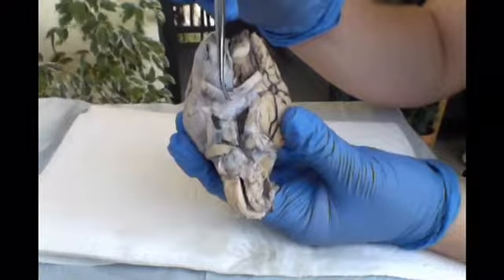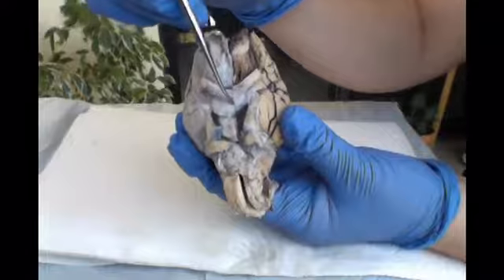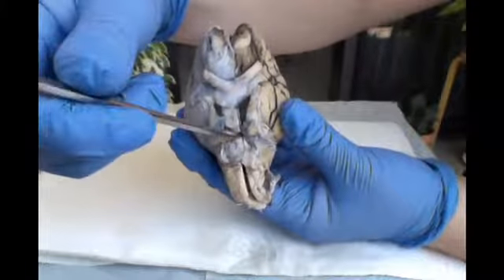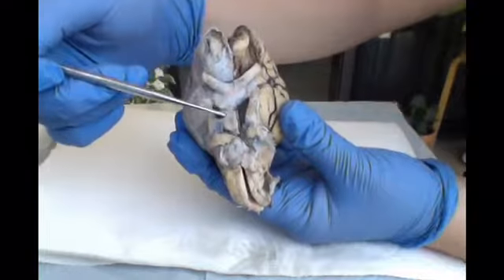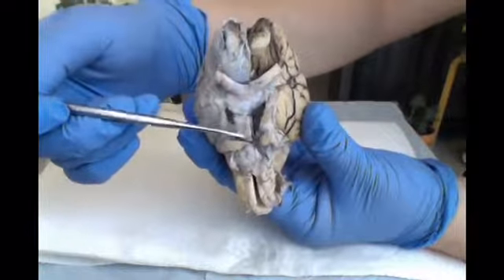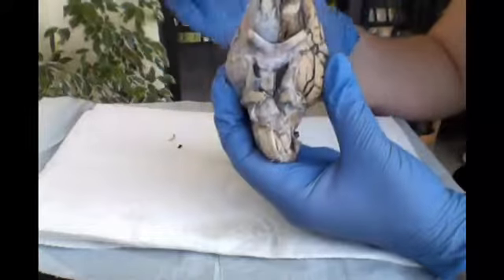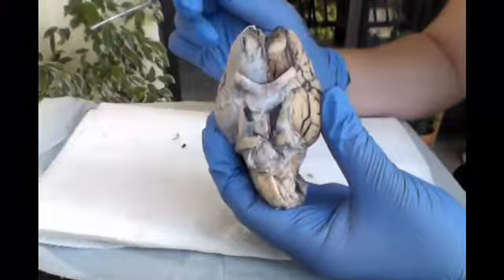And then towards the middle, that's what's called the optic chiasm. And then the cerebral peduncle, which are kind of like these holes halfway towards the back of the brain. And then looking at the pituitary gland, you can see it's this pinkish light colored nub in the middle. Staying on this ventral view of the brain, I'm going to point out the cranial nerves.